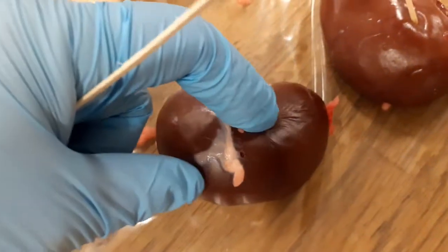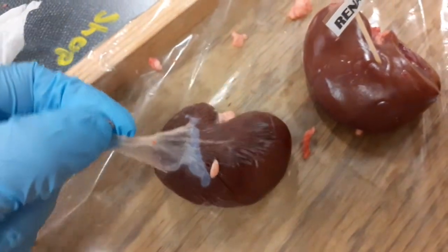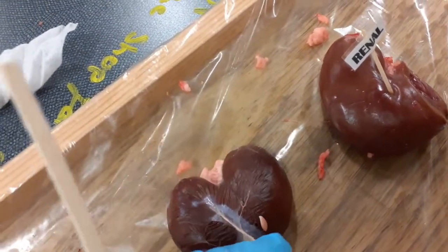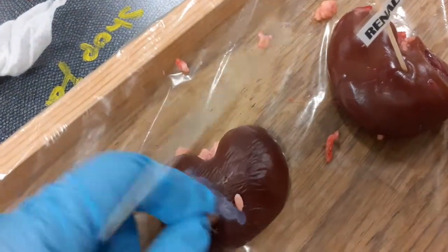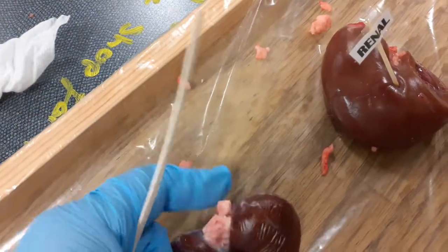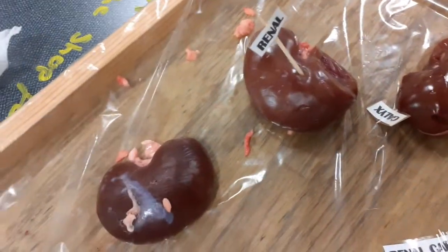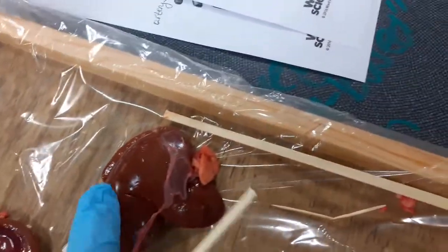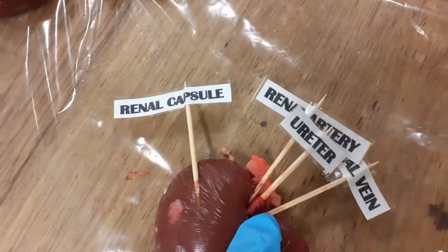In this kidney, we can really see the capsule. There's fibrous tissue that covers the kidney, and once taken off, we can see it changes color. It's red. We can also see some adipose tissue, some fat around, and here the ureter. Where we have more blood, as you can see here, we can also see the arteries and the veins.